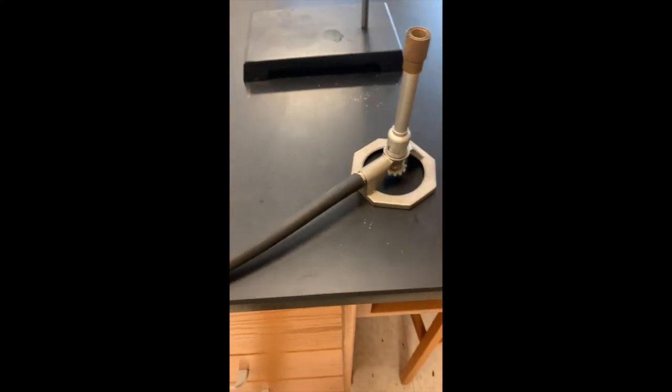Before I actually light this on fire, I want to show you a little bit about how to set up a Bunsen burner.